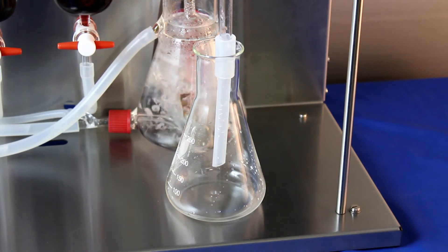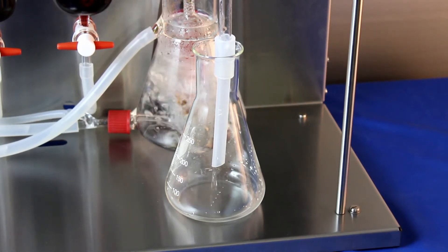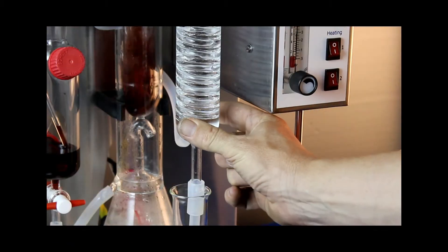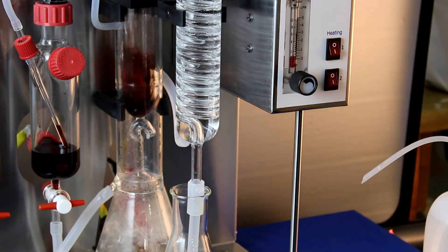Feel the temperature of the bottom of the VA condenser. This short part should be at ambient temperature or lower. If not, the water flow rate is too slow.